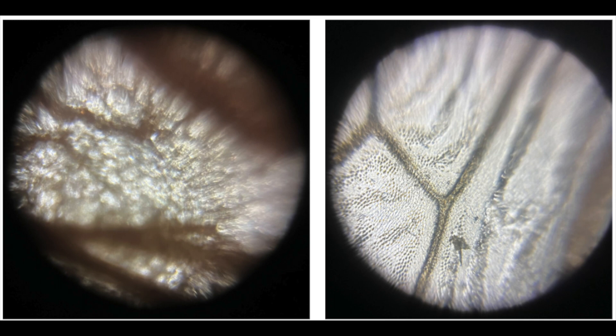While the maple seed develops, the veins branch throughout the leaf, providing water and nutrients to the seed. When the seed is ready to drop, the cells in the leaf dry up and die, causing the veins to darken and become opaque. With less water to weigh it down, the wind is able to carry the seed over great distances.